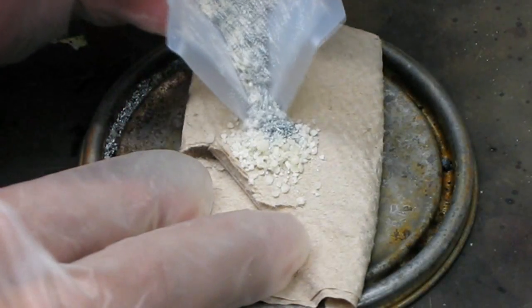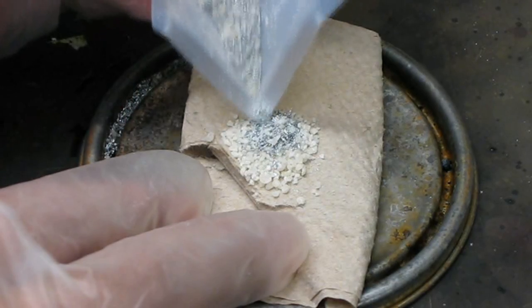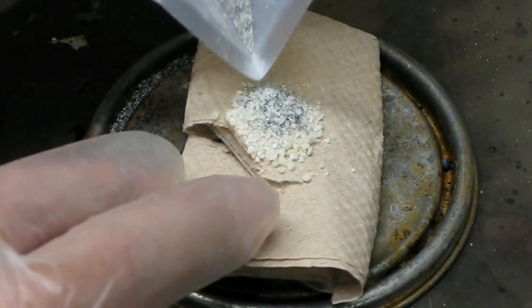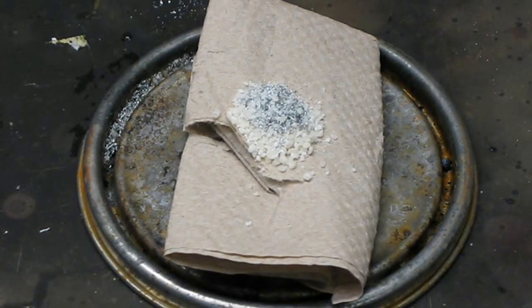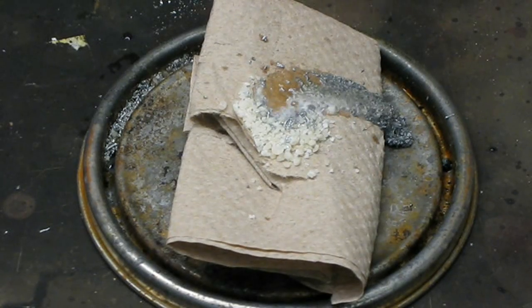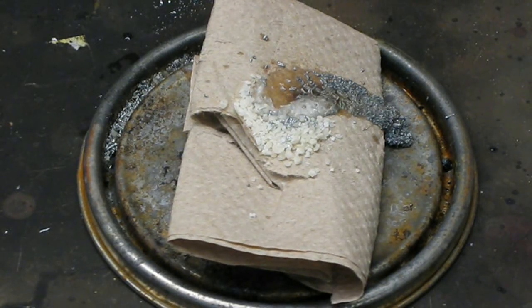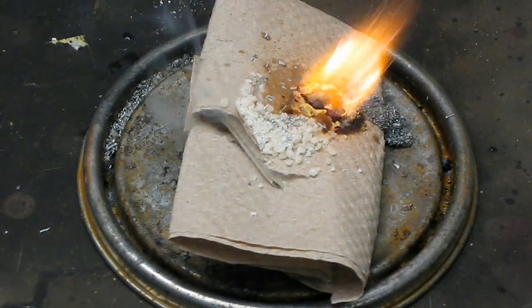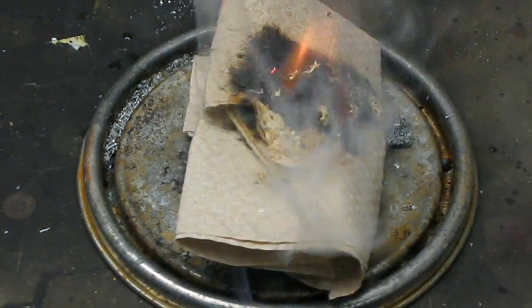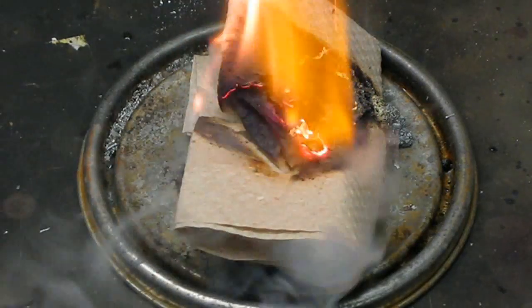Second, a mixture of ammonium nitrate and zinc is placed on top of a paper towel. The finer the ingredients are the better this will work. To activate it a few drops of hydrochloric acid are added. The slanted paper towel messes this up, but it will still burn. And that's fire using ammonium nitrate, zinc, and hydrochloric acid.